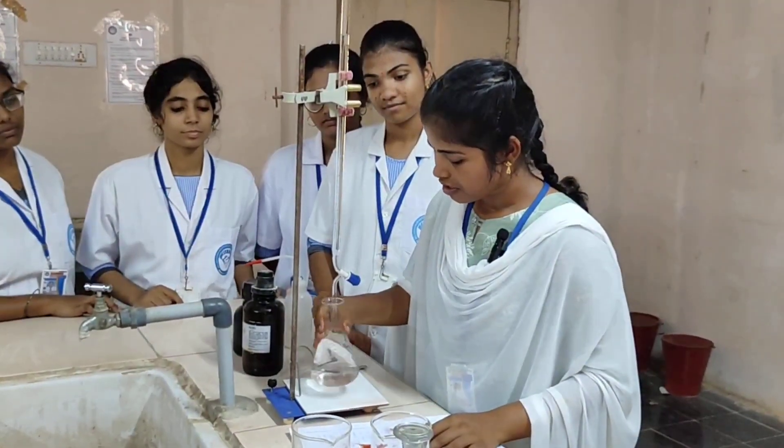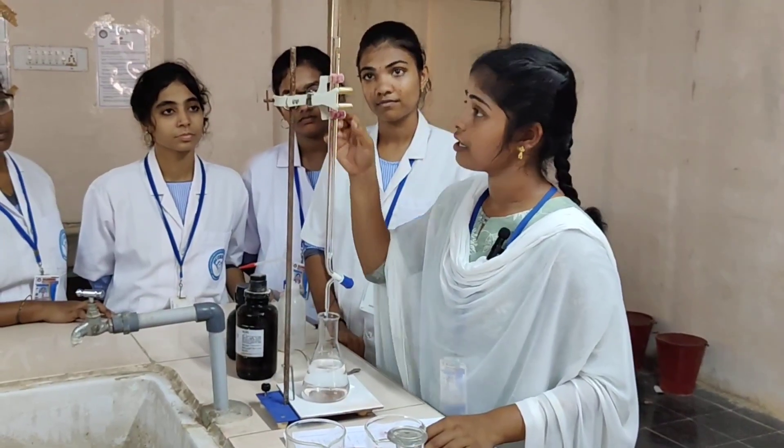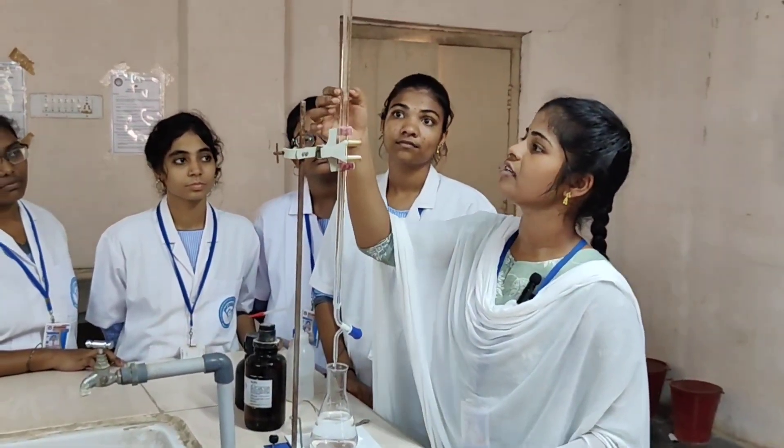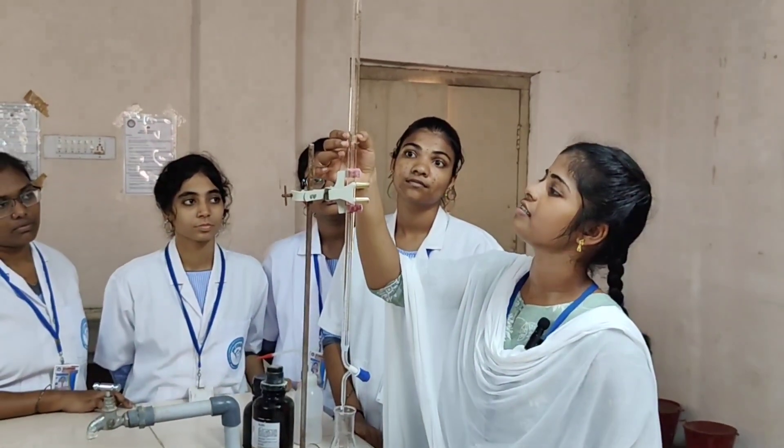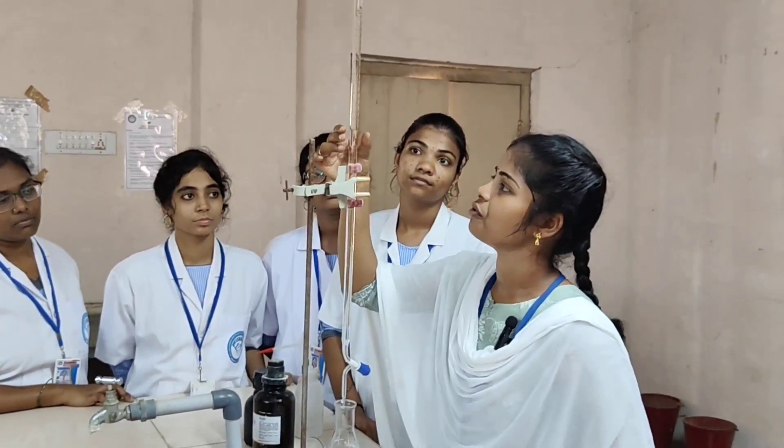Finally, the color was disappeared and this is the end point: 18.2 ml.